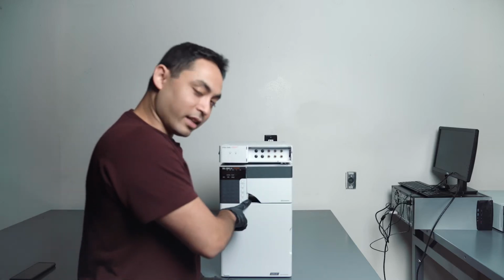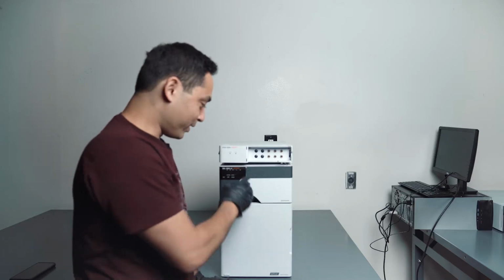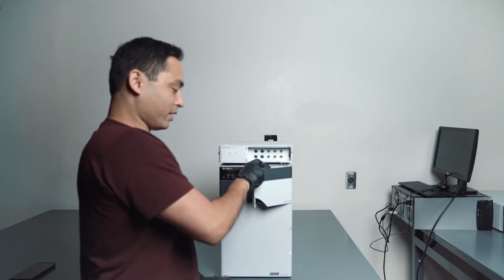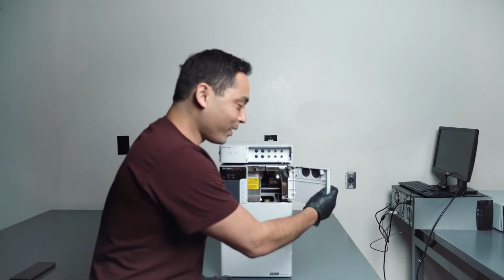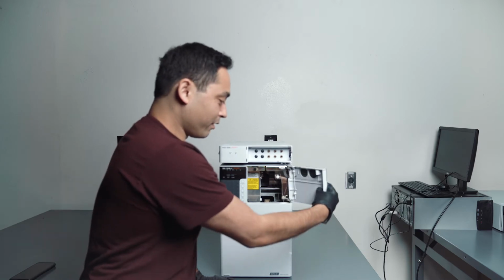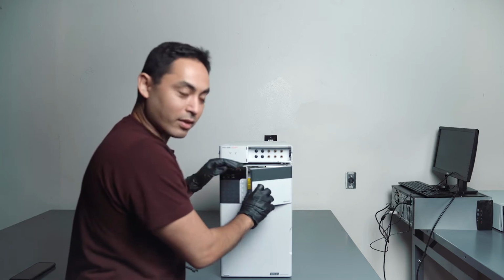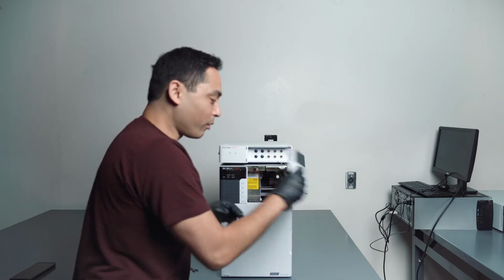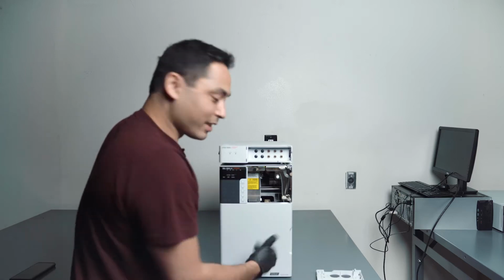As you see here, I broke it. These doors are ridiculous. How do you open them? This is the secret. You open it all the way and then it comes off. And when you wanna put it in, you put it in all the way, that's how you do it. Otherwise, it'll drop off and break and you get one of these. So let's open this sucker up.